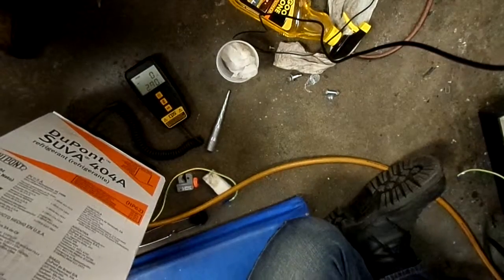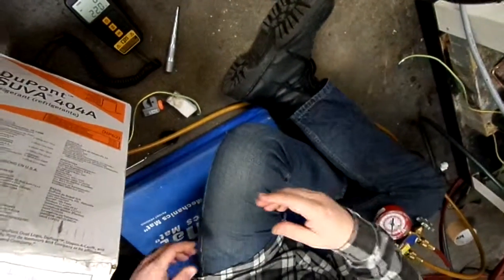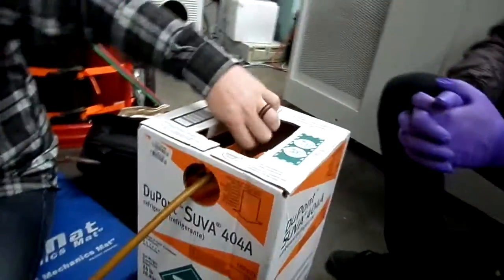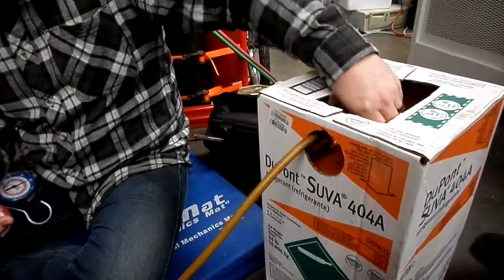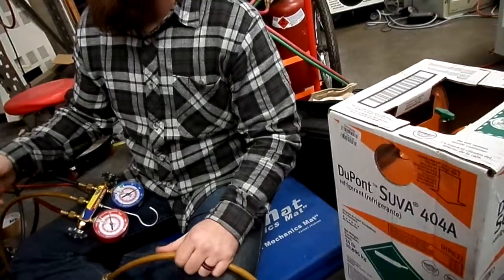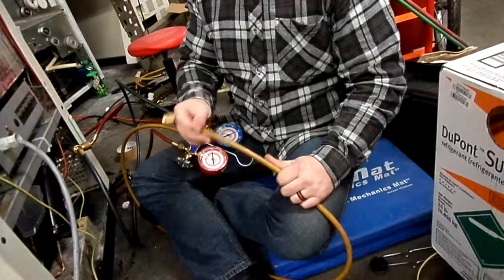We plug in? Turn it on. And you turn off your gauges obviously after you're done filling. Kick the machine on. You put your tank back over. Close the valve. Take the hose off. And right now there's still liquid Freon inside of this hose. That's part of that 300 charge. So when the machine kicks on, the compressor kicks on, it starts throwing the Freon elsewhere in the unit. You can open up this hose again and it'll take all the Freon from inside of the hose.